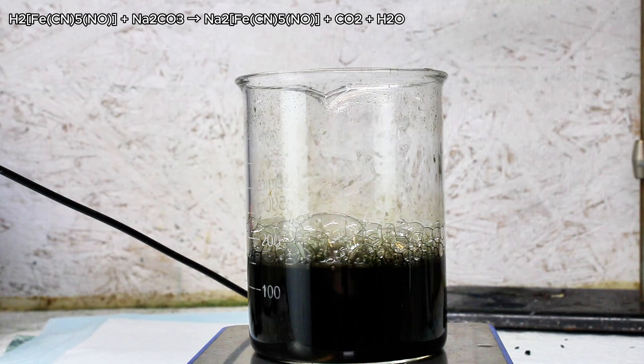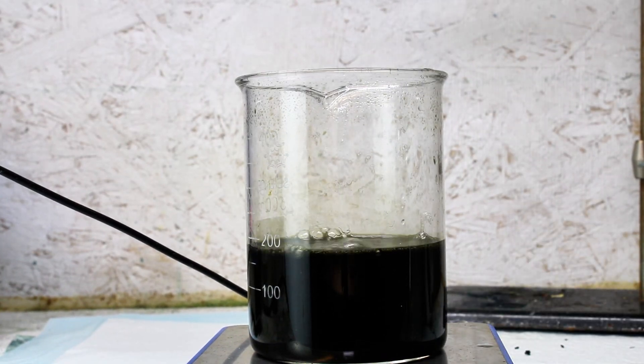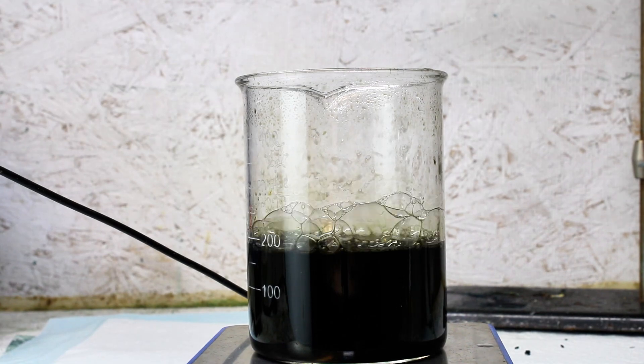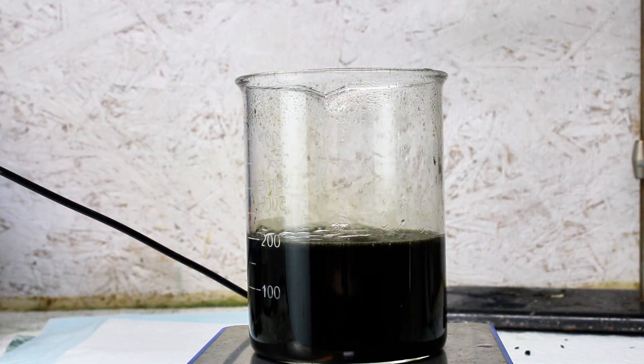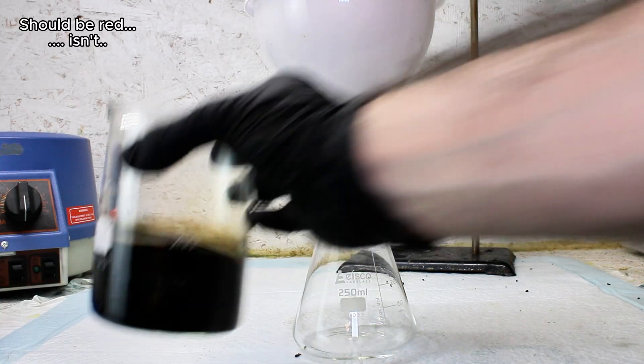I go ahead and keep adding sodium carbonate until the solution stops bubbling, which indicates that this step is complete. At this point, I have synthesized sodium nitroprusside, which means this solution should be very bright red, and clearly it is not.